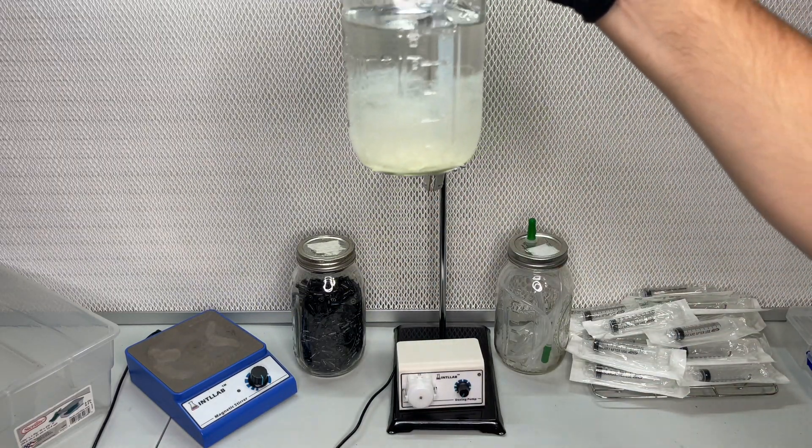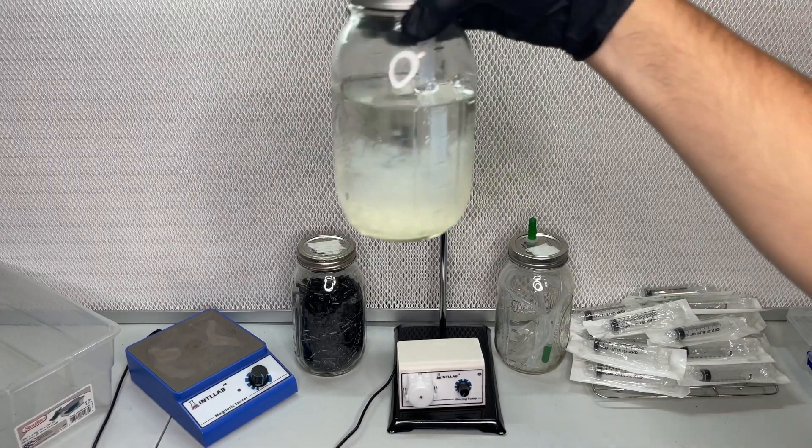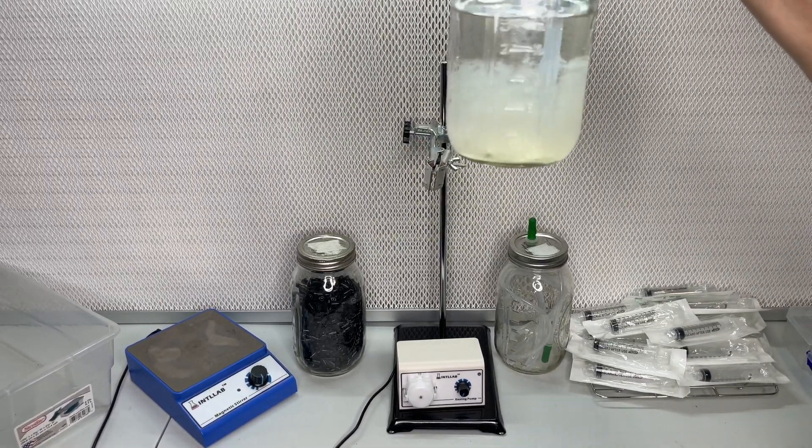Welcome back to Spore and Sprout. In this video I'm going to show you this system I made using a peristaltic pump to make mushroom spore syringes or liquid culture syringes.